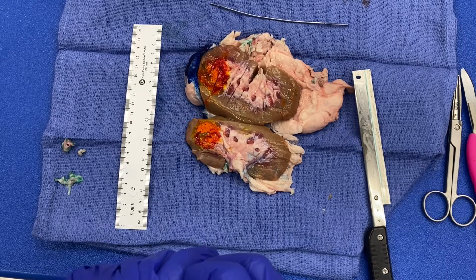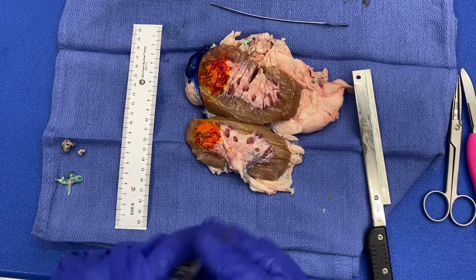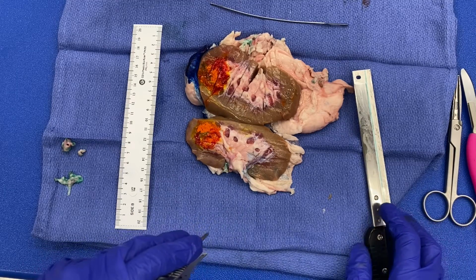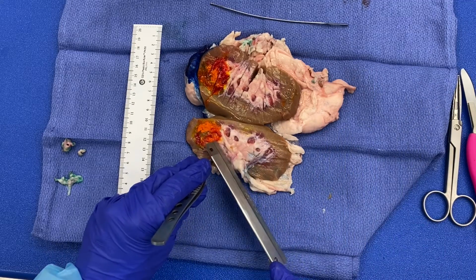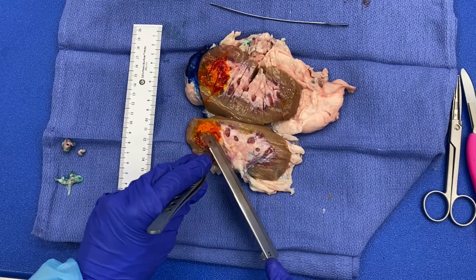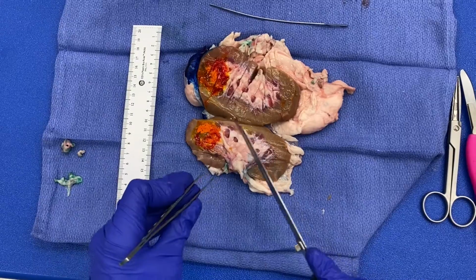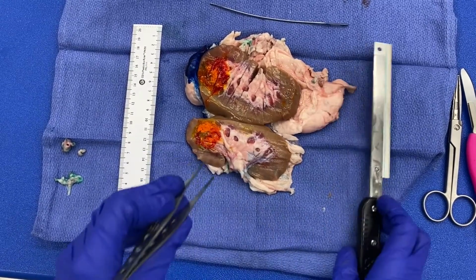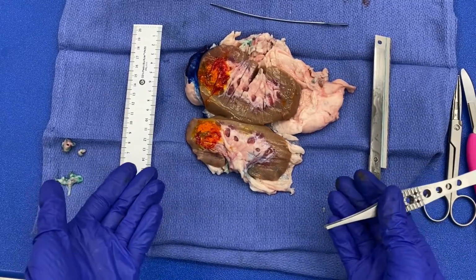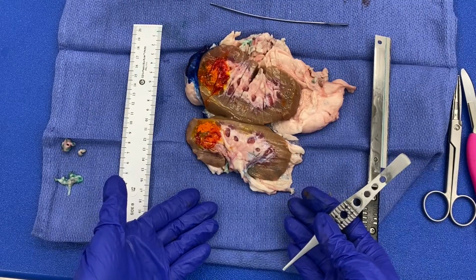So due to the friable nature of renal cell carcinomas, it is important that you do allow your specimen to fix so that you don't accidentally transfer tumor cells to uninvolved areas. So one thing you may want to do prior to sectioning is at least cut in almost like a fan fashion, so that you can at least maintain the relationship of your tumor to that renal sinus fat. Now remember, the kidney now has 2 sides because you've cut along the renal pelvis into 2 halves.